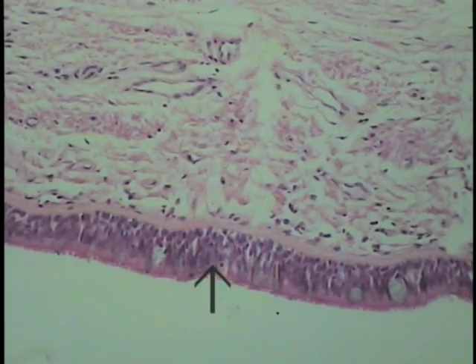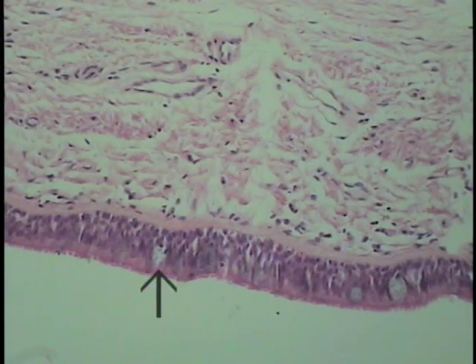The tracheal wall is seen at a slight increase in magnification, that is with the intermediate power objective, showing you the respiratory epithelium, or the details perhaps a little bit better. Even at this intermediate objective, one can make out the tufts or clumps of the cilia. A few goblet cells can also be made out at this low magnification, as indicated by the pointer, and there will be more hidden in the underlying epithelium.